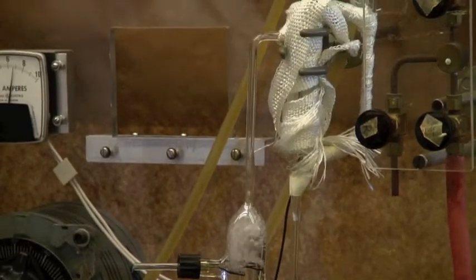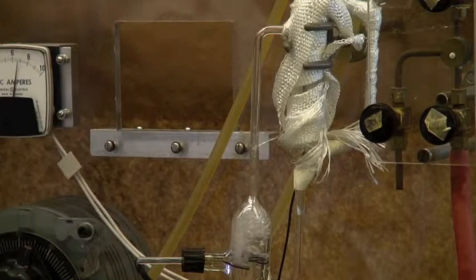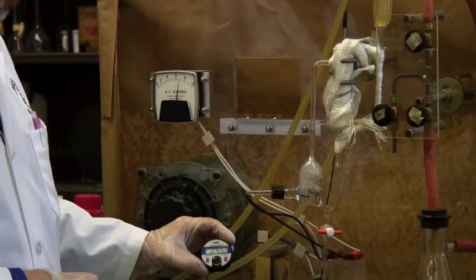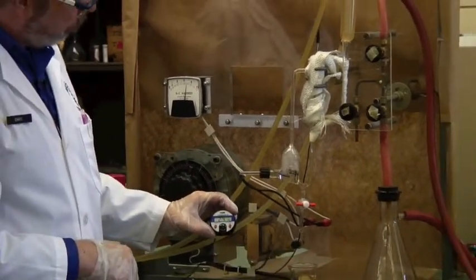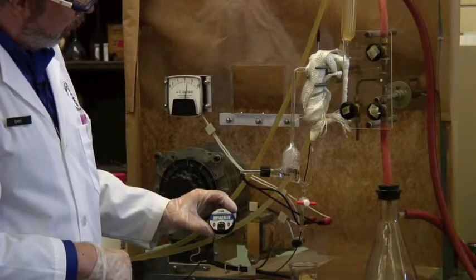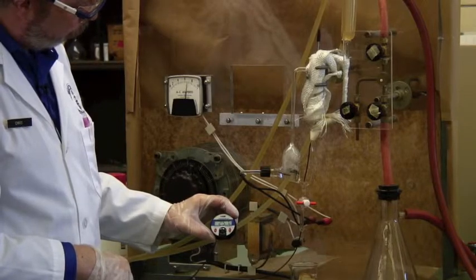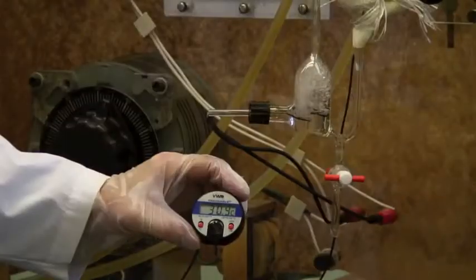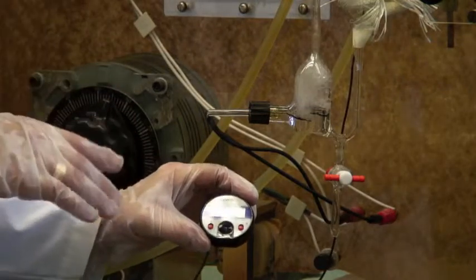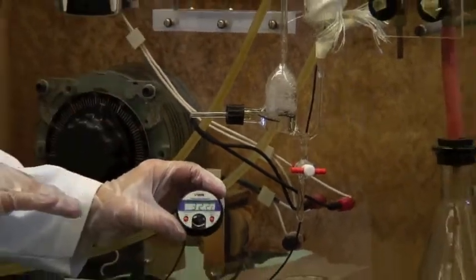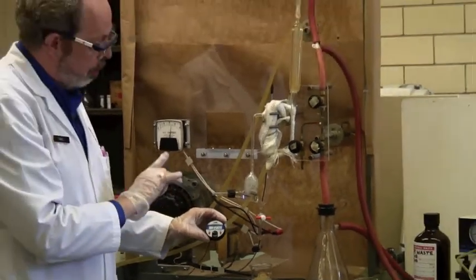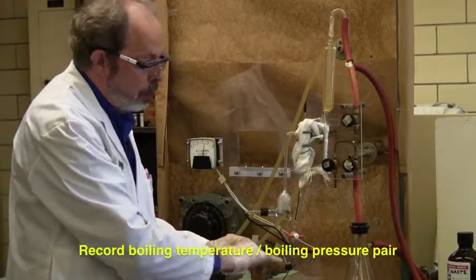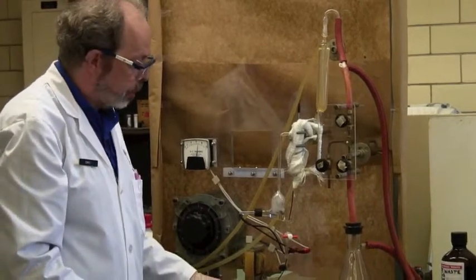However, we do have solvent here, and we're now getting considerably more liquid going up there than before. This was at about 19 degrees. It's 24 and a bit, and this will start heating up considerably as the boiling process brings the liquid all the way up. We've got this at about 31 degrees, and this doesn't seem like much, but remember this is a reduced pressure. That probably is pretty close to the boiling point of methanol at the appropriate pressure. So 33.9 at 56.8 kilopascals.